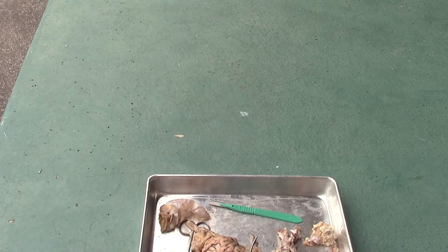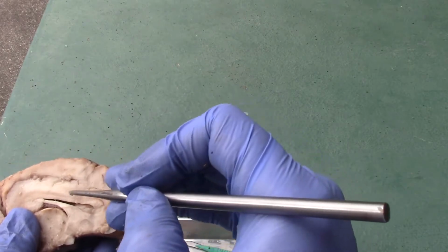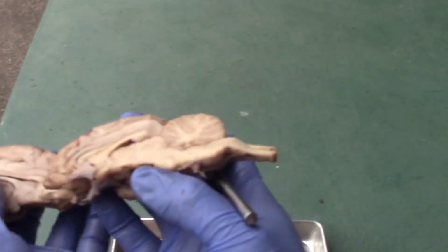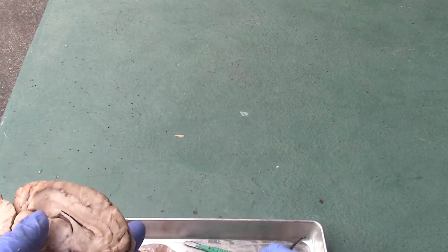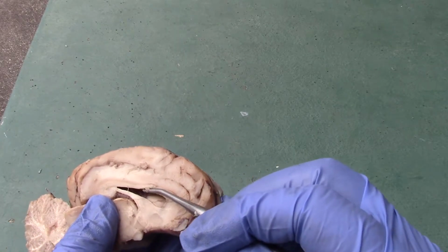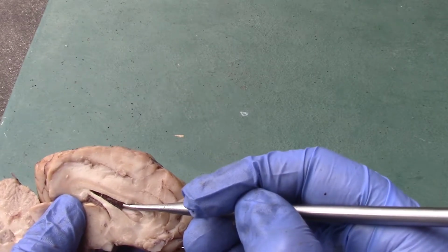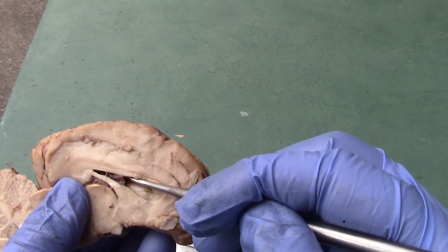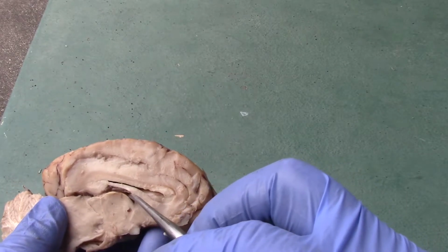Let's go ahead and look at the spaces in the brain. Okay, you already know this space here, right? We said that it was being blocked by this structure here, which was that septum pellucidum. So in this one, you can actually see that there's a space beyond that septum pellucidum, and this is the lateral ventricle. And with the lateral ventricle, once again, what is this black stuff that makes the CSF? That's the choroid plexus of the lateral ventricle. You still see the choroid plexus of the third ventricle, which has that space right there.